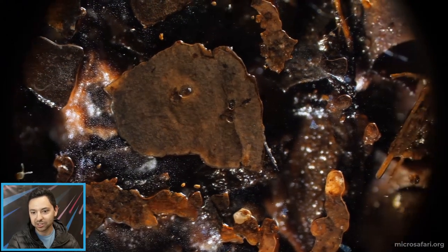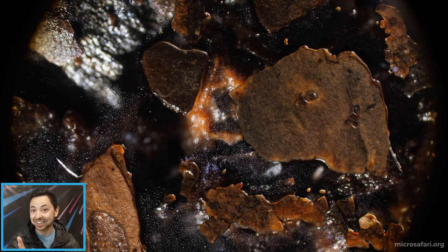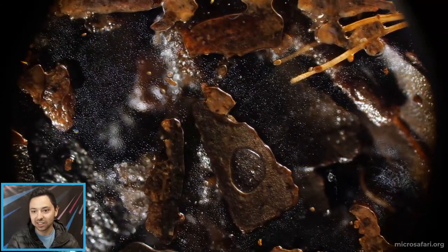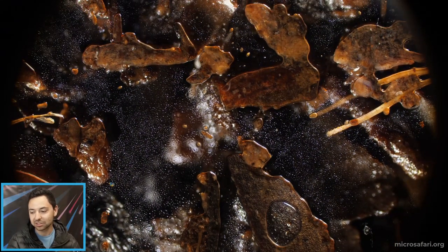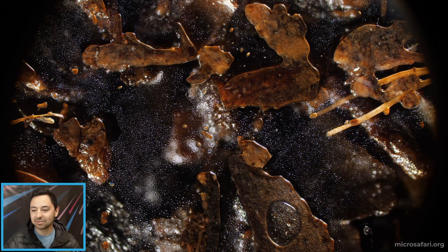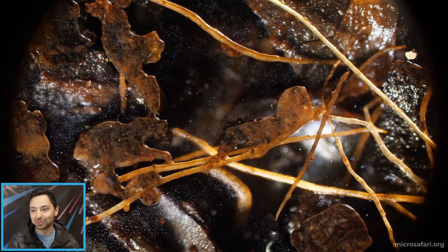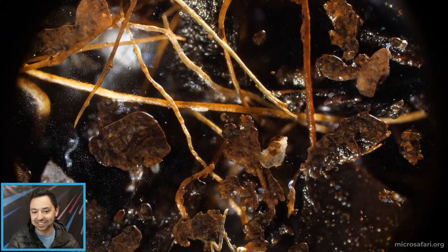By the way, springtails are called springtails because they've got a spring on their tail. They can use it to jump around like little fleas when they're scared. It's not super common that they'll jump around in here just because they don't have any predators that are big enough to fit inside this little safari slide. But sometimes if there's light that shines on them they get a little startled — you'll see them jump, and it basically looks like they just teleport to another spot because they jump around so fast.